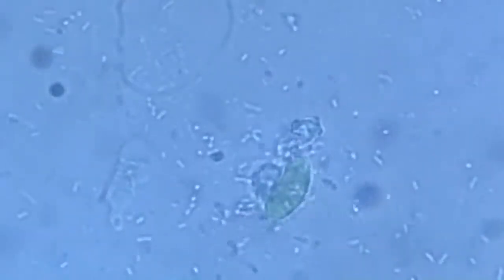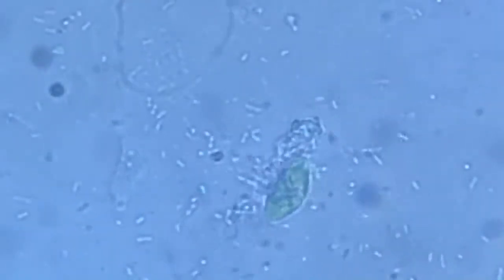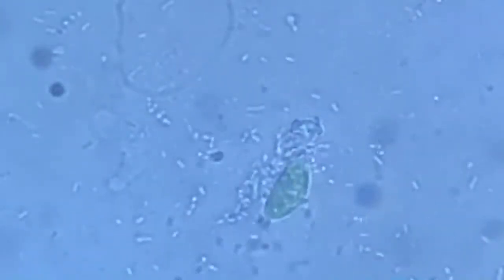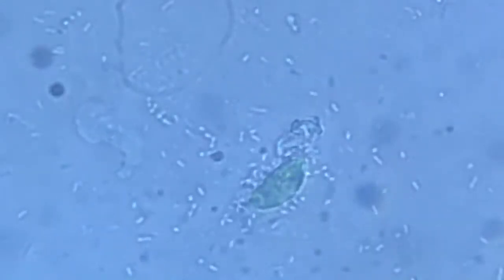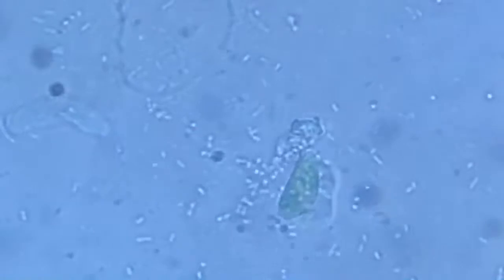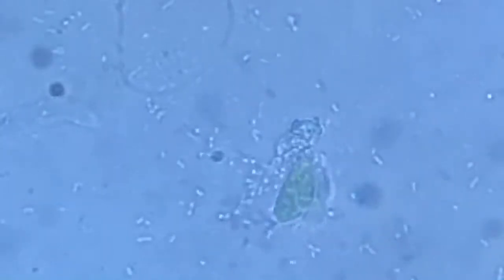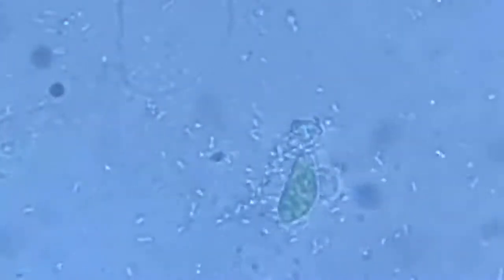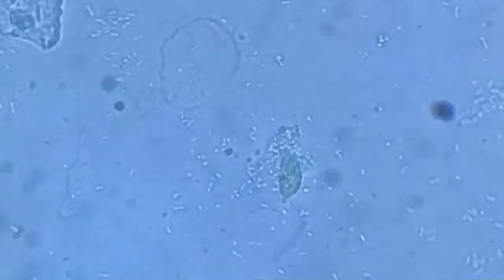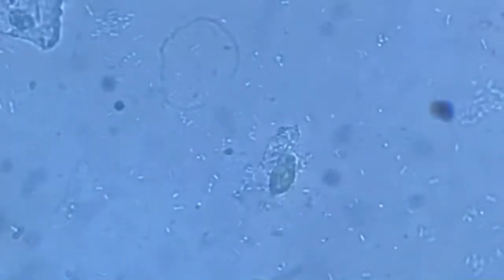Pretty fascinating. That was a real hungry amoeba. Still trying to grab him from any possible place where it can take a good grip and mouthful of it. But that's just too much that he's wishing for. I don't think he'll be able to make it.